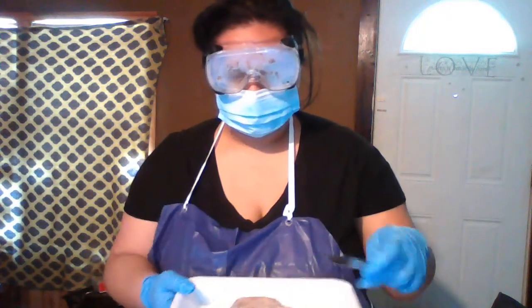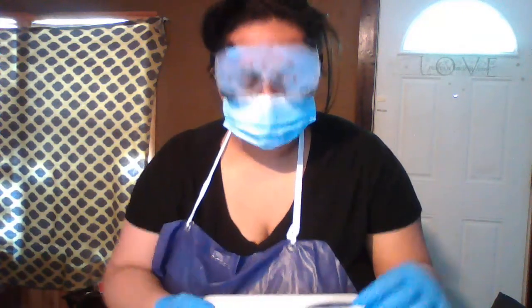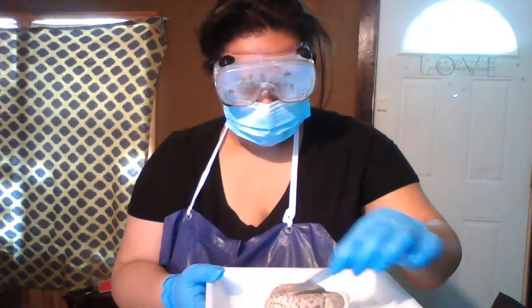If y'all see me looking to the side, then I have the directions on the side of my camera on my laptop. Oh, the central sulcus is on the top here.